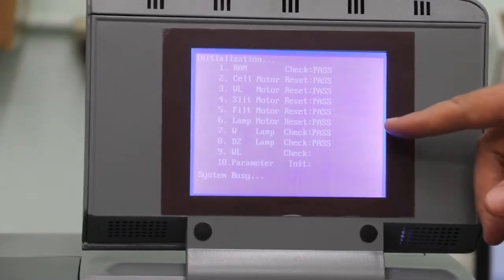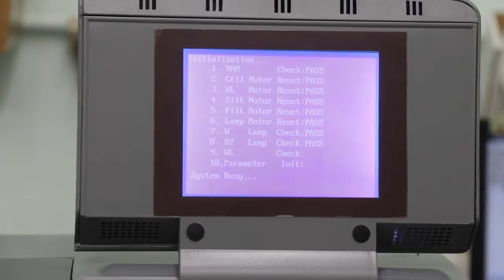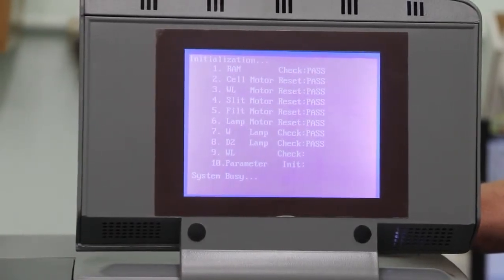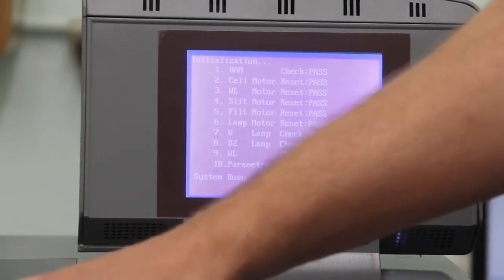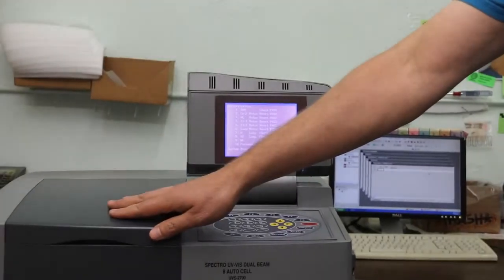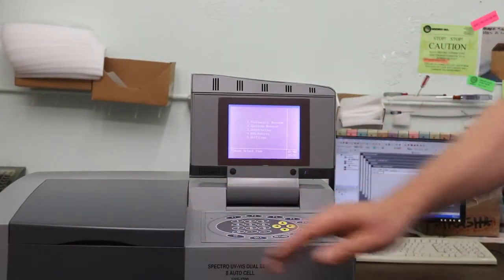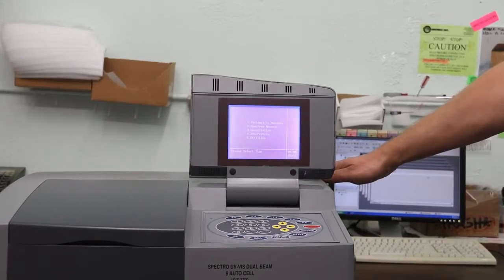If there's a W lamp failure, there could be two possible causes. One is the lamp is out or misadjusted, or the cell changer has blocked the path of the light to the sensor. First, we'll look at seeing if the lamp is operational.